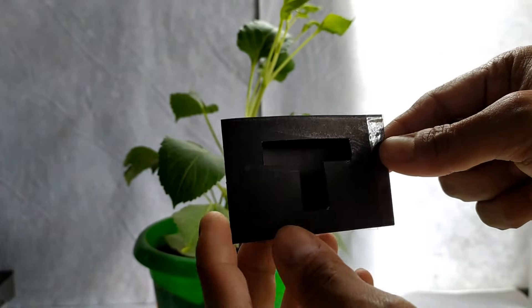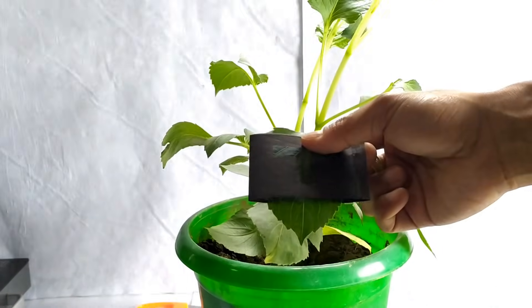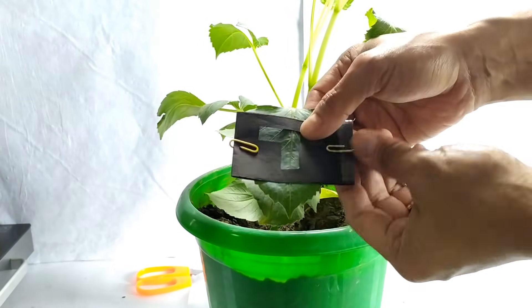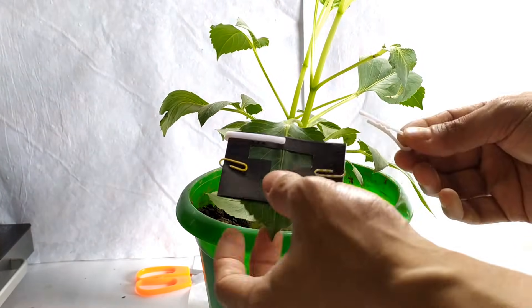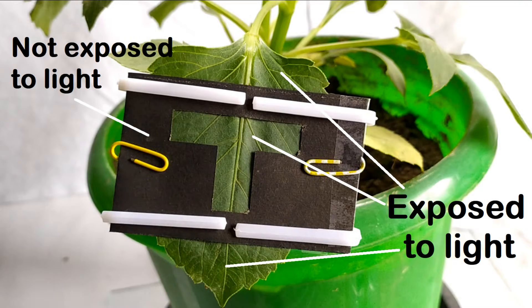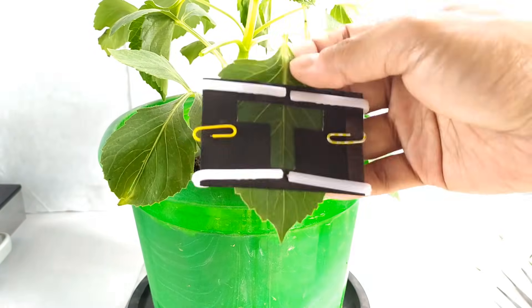To make this experiment a bit more interesting and fun, I have carved out my initial, which is the letter T, on the black paper covering the leaf. Cover both surfaces of one of the leaves using this piece of black paper and secure the paper on the leaf using some paper clips. The parts exposed to light will receive sunlight, while the parts covered by the black paper will remain in the dark. Leave the potted plant in sunlight for several hours, then detach the leaf from the plant and remove the black paper.